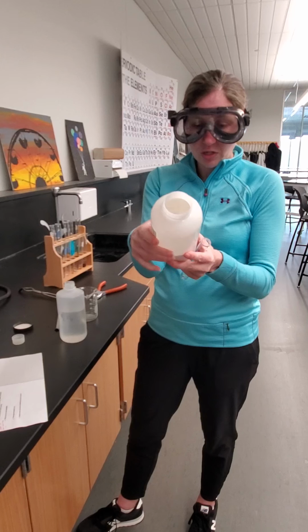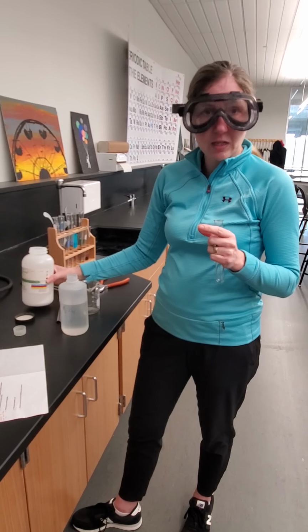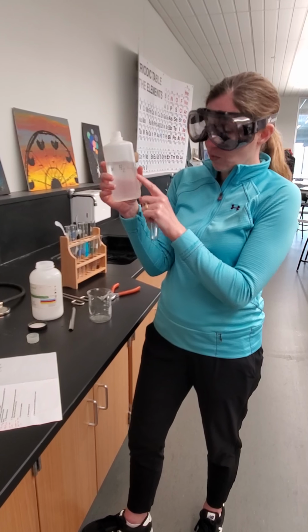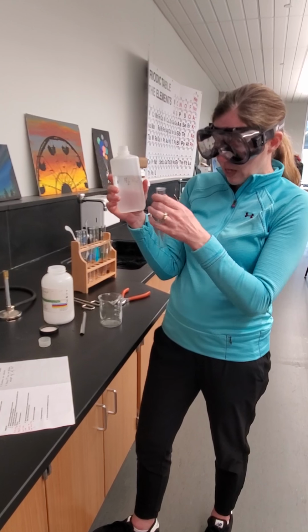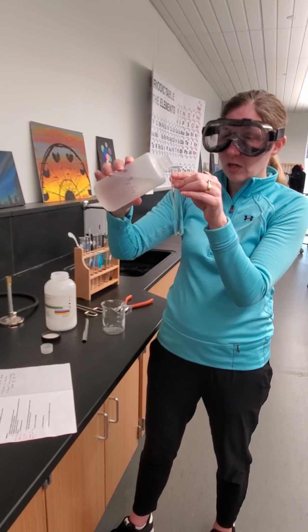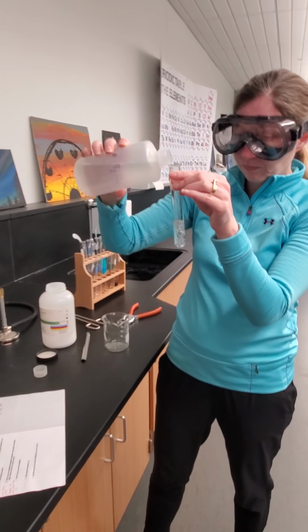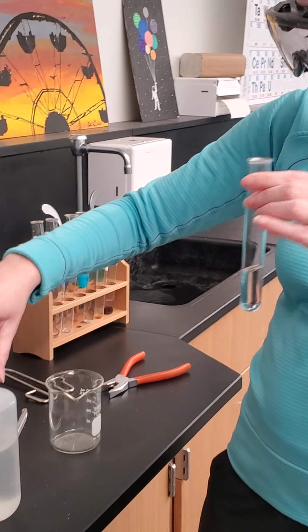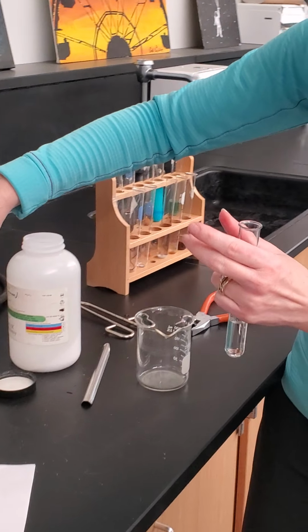is a white powder, another compound, sodium and carbonate, ionically bonded together. The hydrogen sulfate is an aqueous solution again, hydrogen ions and sulfate ions floating around in solution. For this reaction, we're going to start with some of this aqueous solution in the test tube. I'm going to be adding the solid sodium carbonate to this.